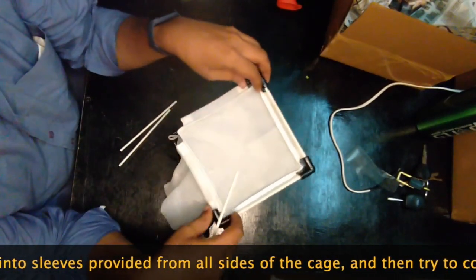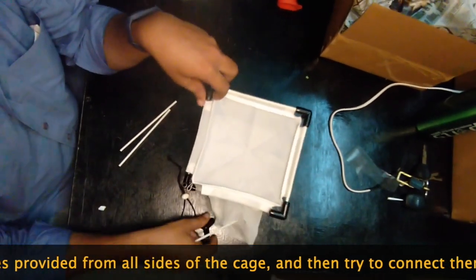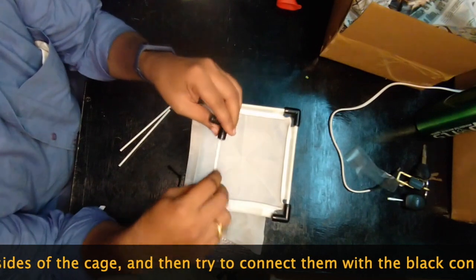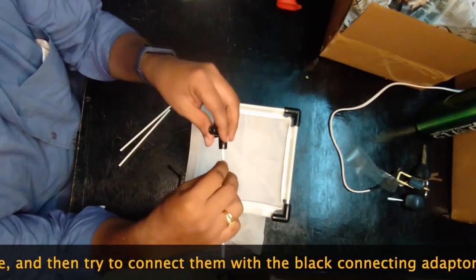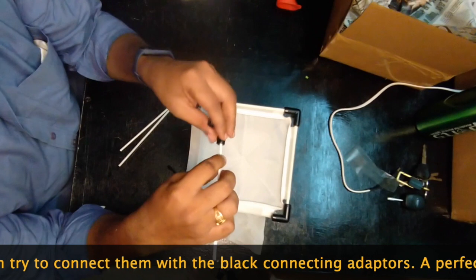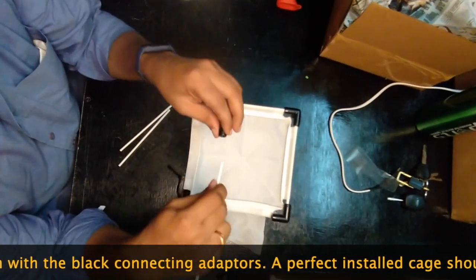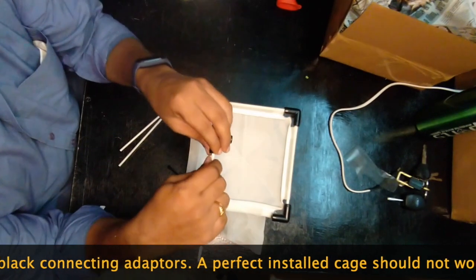What you have to care about before you do the installation is please try to do a kind of loosening of the hole so that you don't have difficulty installing and uninstalling.